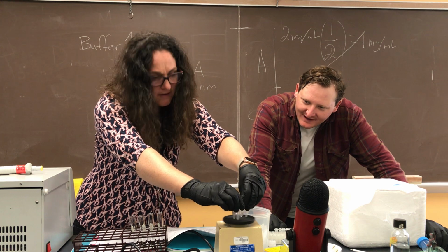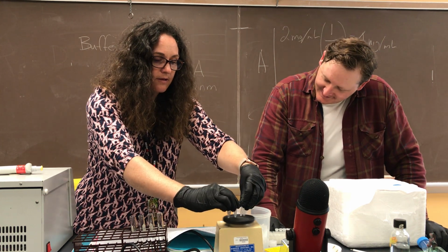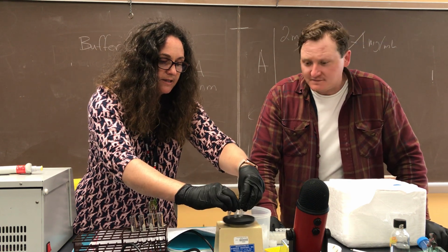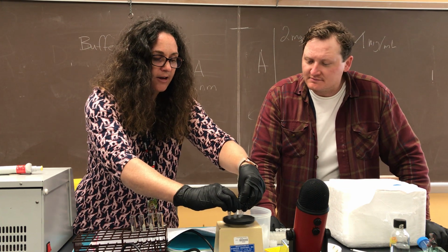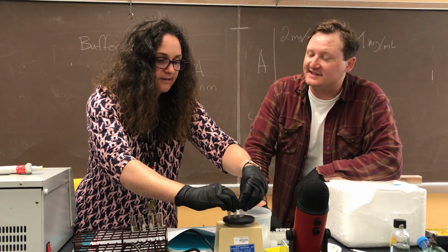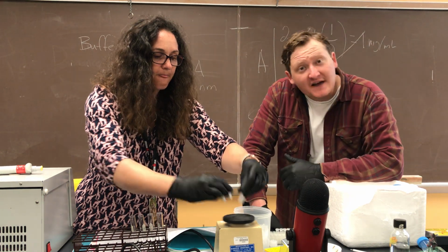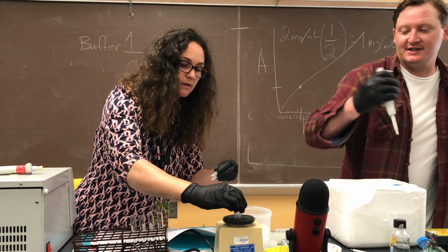They always give us a bit of a hard time. We could use a pipette to resuspend these. That's true. The pellets are not very compact. They're not wanting to go into the solution. Well, since it is a demonstration, we don't necessarily have to get all of them completely resuspended. But yeah, that's a classic technique actually to mix a solution.